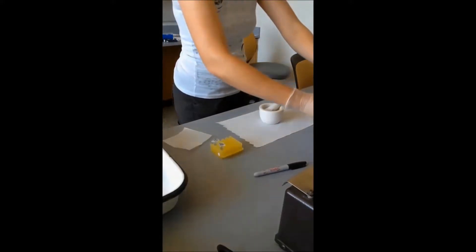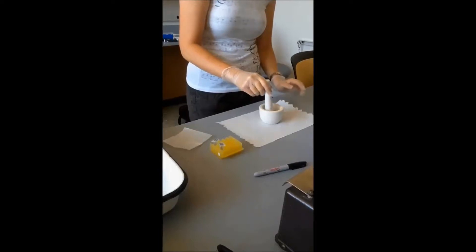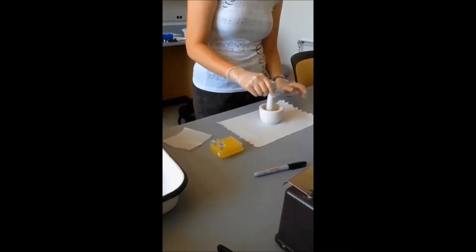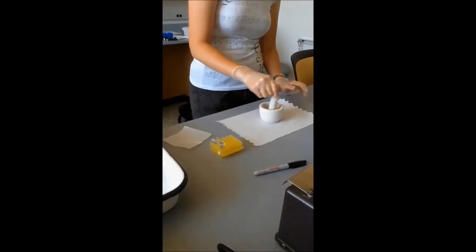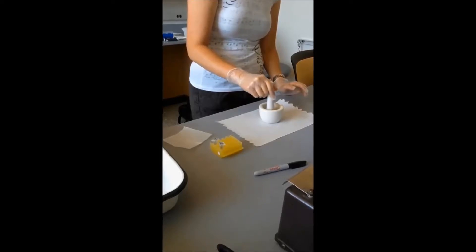And this will cool the sample and we'll have the sample stay nice and cold while we are grinding it. So while it cools down some and evaporates, we are just very carefully going to start to grind it. And it'll be easier to grind and not lose sample once some of the liquid nitrogen has evaporated.